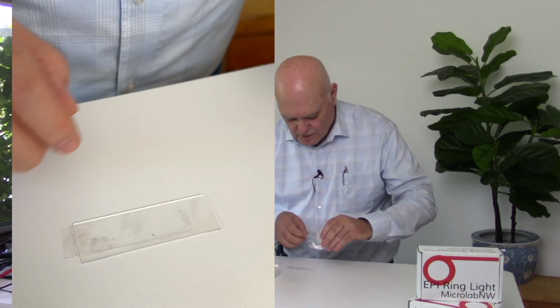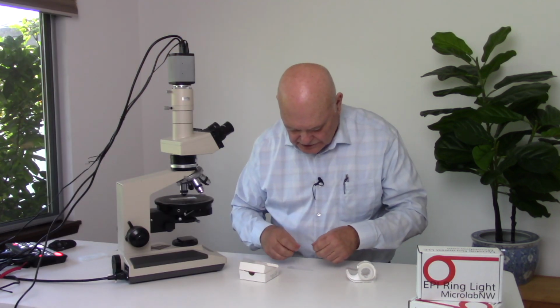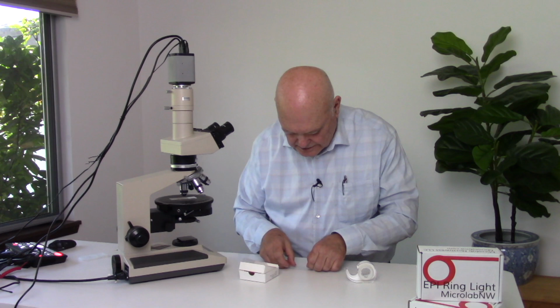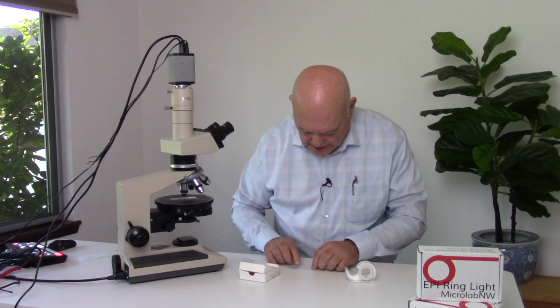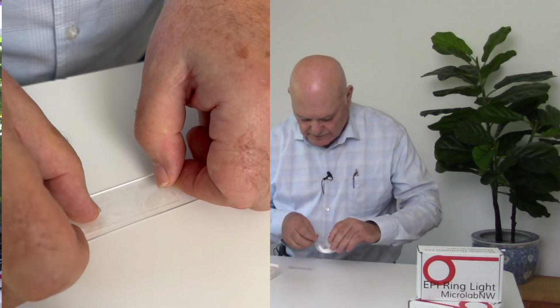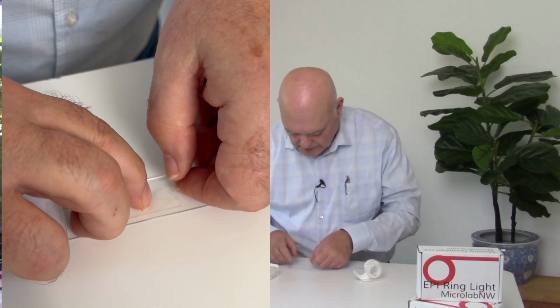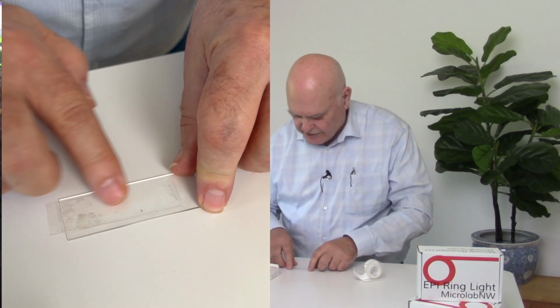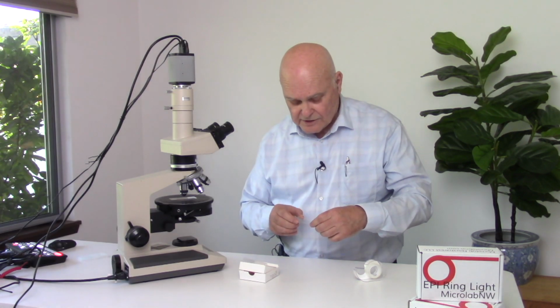We'll take one more, and that should give us another quarter wave plate, 4 layers. Now, just to make sure, stack that right on top. What I'm going to do is I'm going to add a little bit of tape at one end. That's 5 layers. So now we'll see which number of layers gives us the best quarter wave plate. So let's go back to our microscope.